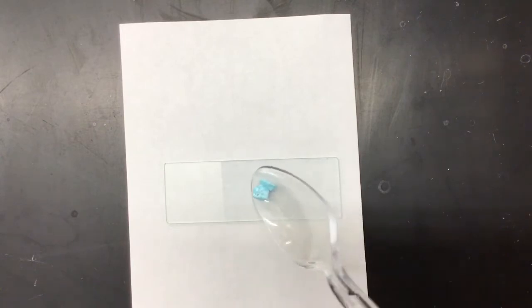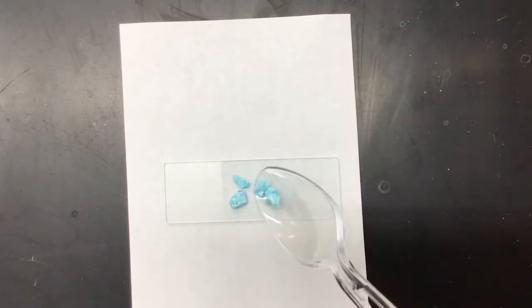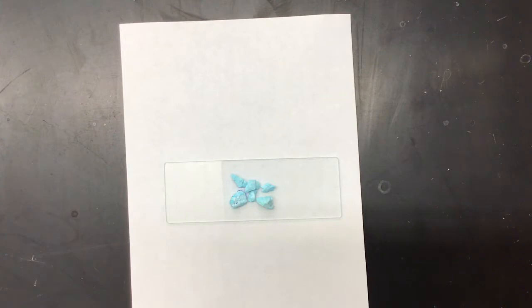I will be taking this one at a time. So I will go through in order, starting at number 1. We're going to look at our copper sulfate. Now, to prepare my slide, I only need a few grains on my slide here, this little glass piece, so I need about 4 to 5. These are grains of copper sulfate, which you might notice are quite big grains.